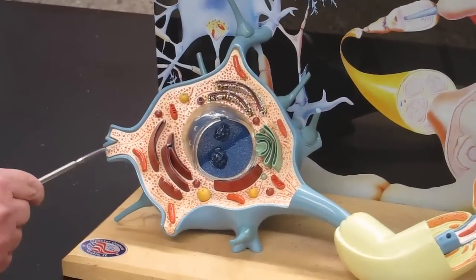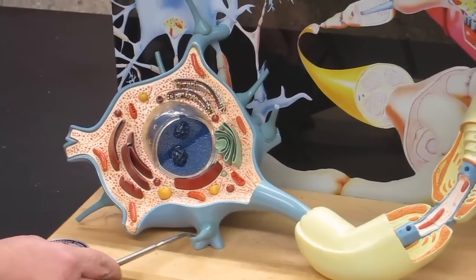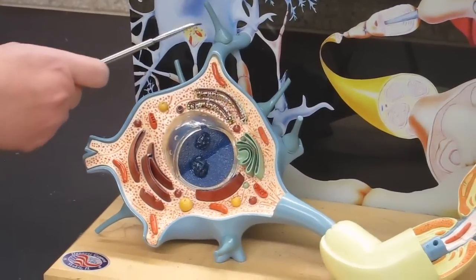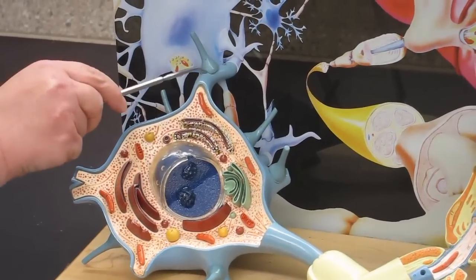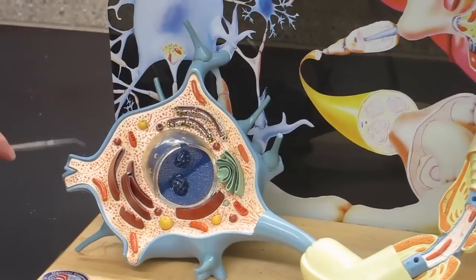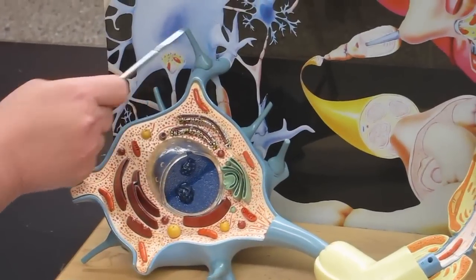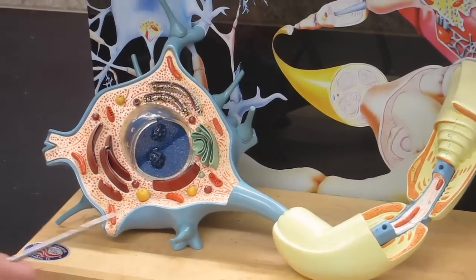You can see where the dendrites are — here's a piece of a dendrite, and the tips have been cut off. There are other pieces where dendrites would have been attached, extending out. What they are showing you here is how many other neurons are in contact with this neuron. All these little tips ending in flare endings are axons with axon terminals. You can see there are eight different synapses from axon terminals present on this one neuron, and most of them are present on dendrites. This is where we're using our dendritic surface area to receive information from other cells.